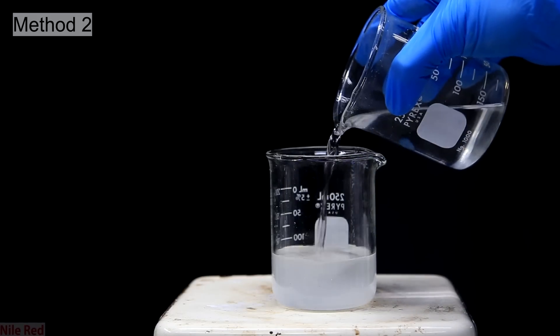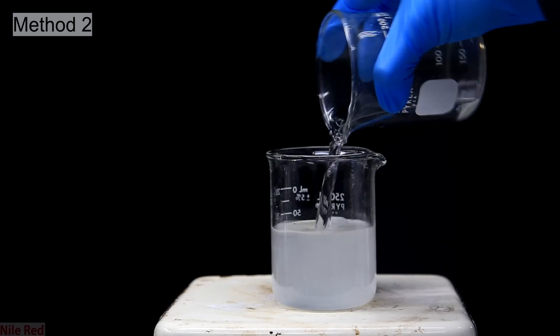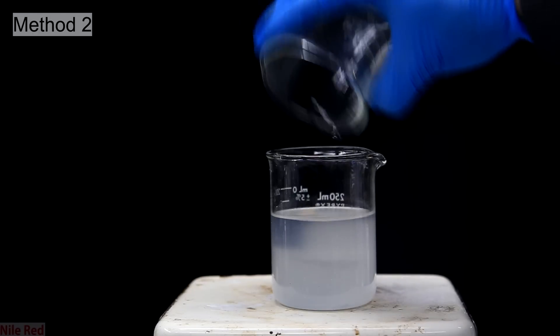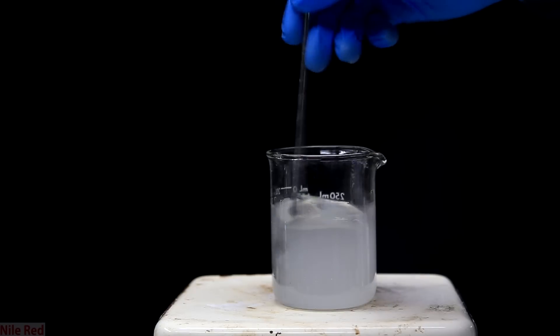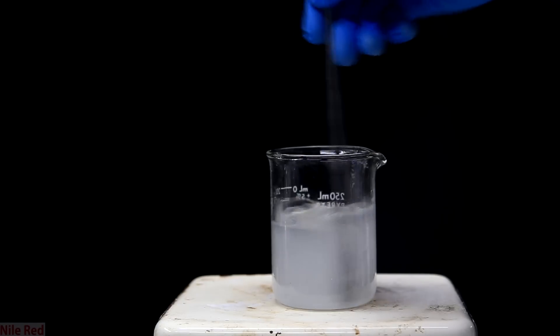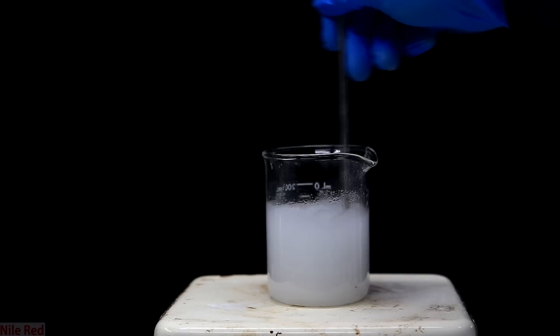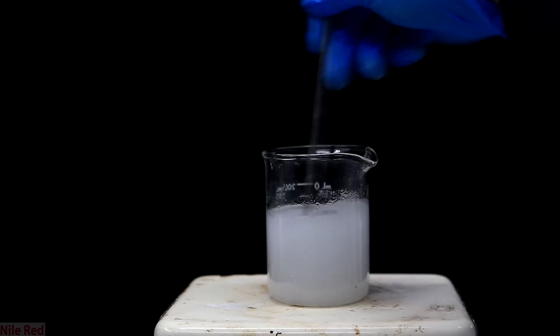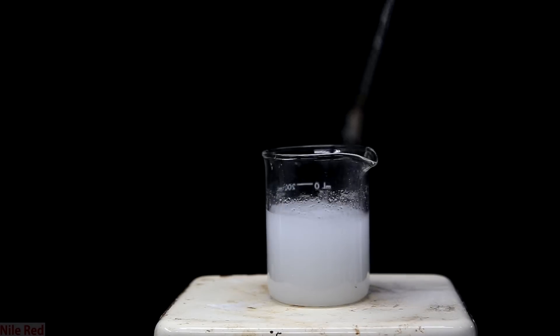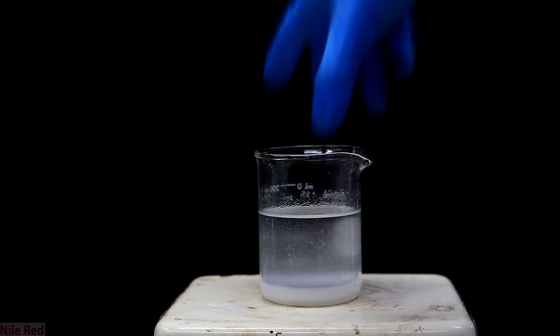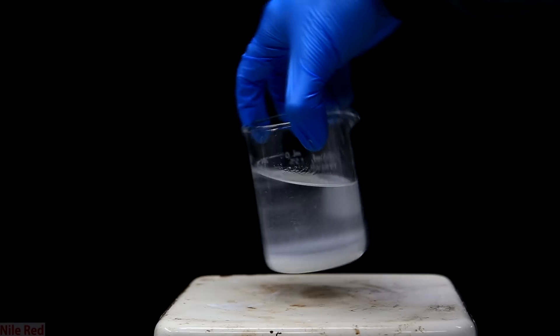We have a small amount of lithium hydroxide solution here, and I pour in isopropyl alcohol. I'm sure I poured in way too much. Anyway, I start to stir after it's added. Very quickly the solution becomes cloudy, and this is the lithium hydroxide precipitating out. The lithium hydroxide is really not soluble in isopropyl alcohol, so when it's added to the water, this destroys its solubility in the water and it precipitates out. When left to stand for a few minutes, you can see it forms a layer at the bottom.